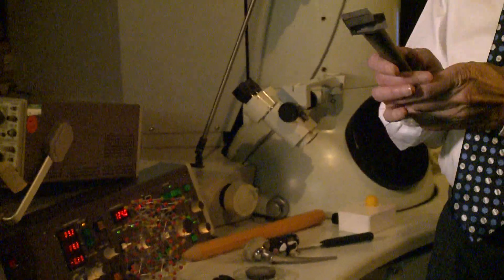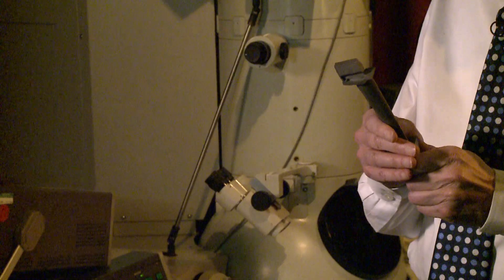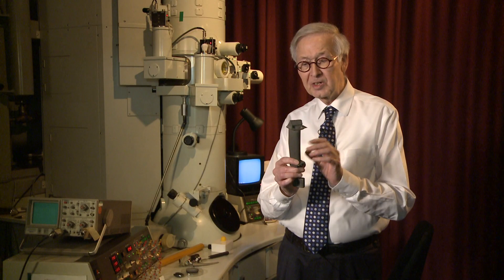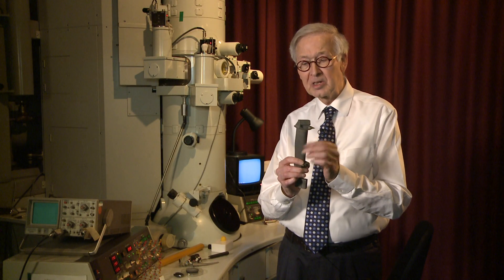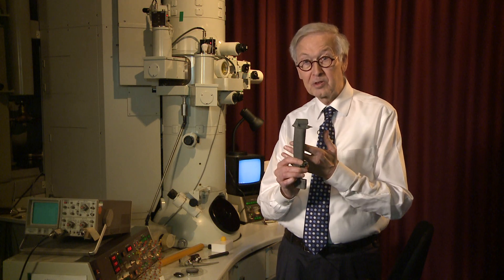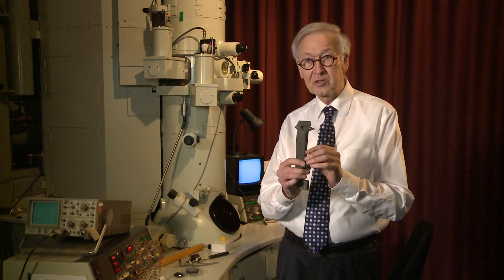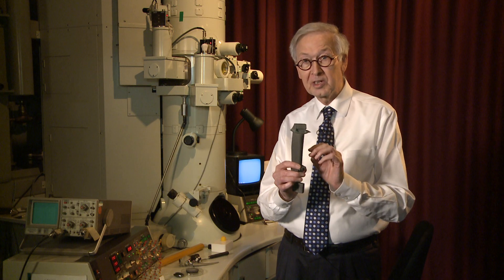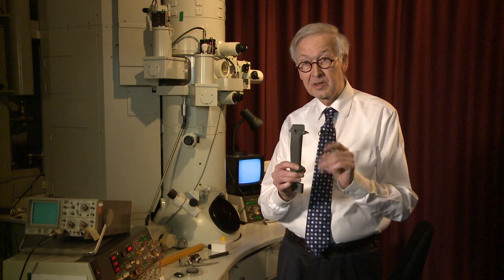For example, this turbine blade, which is in an aerospace engine at its hottest point, contains 18 different elements. We know where these elements are because of the electron microscope, and without the electron microscope, we just wouldn't know where all these elements are, or where the defects in these materials are.